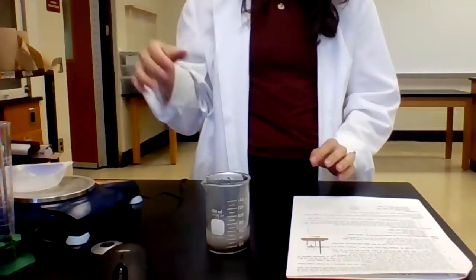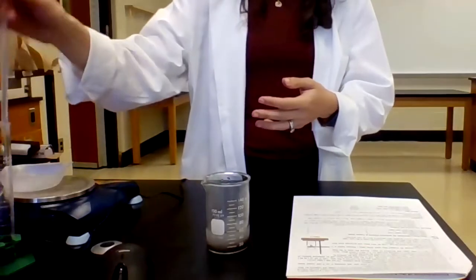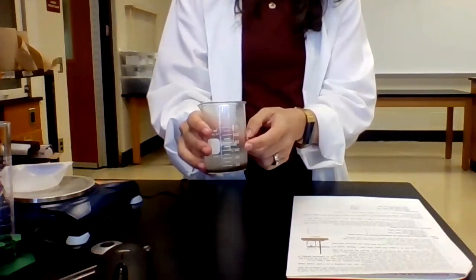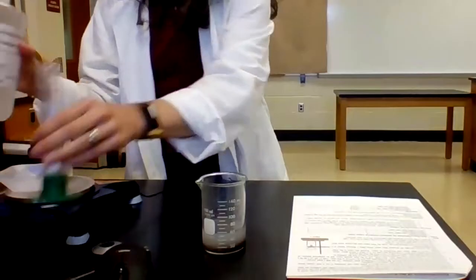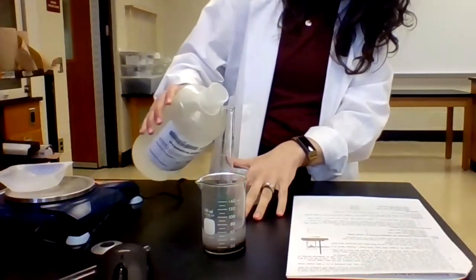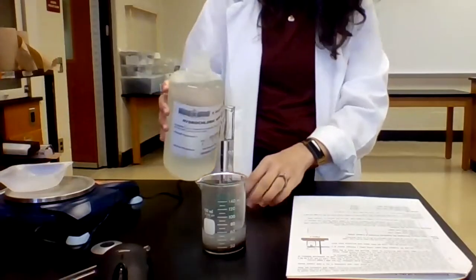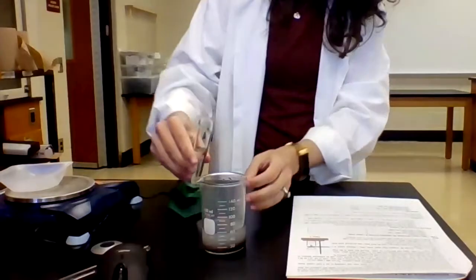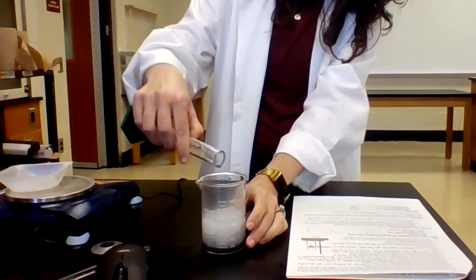So what I'm gonna do is I'm gonna add excess hydrochloric acid to react with any of the unreacted zinc. That'll cause the zinc to turn into zinc ions and go into solution so that my solid will just be the copper metal, the product that I want. So I'm gonna take another 25 milliliters of my 3 molar hydrochloric acid. And again, hydrogen gas will be produced in this step from this single replacement reaction. So see the bubbles forming.